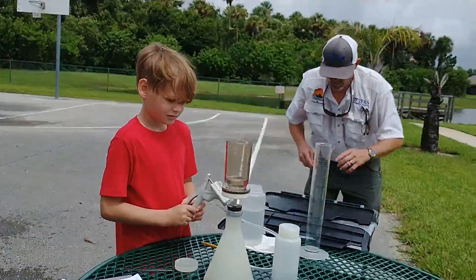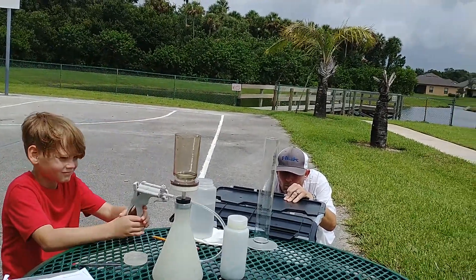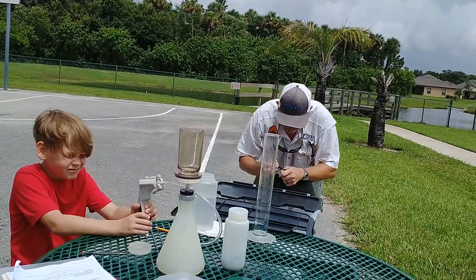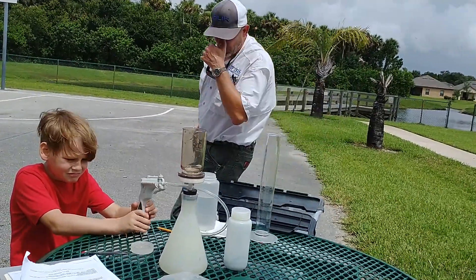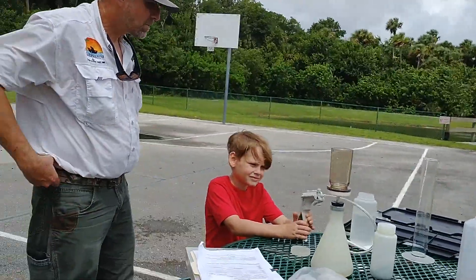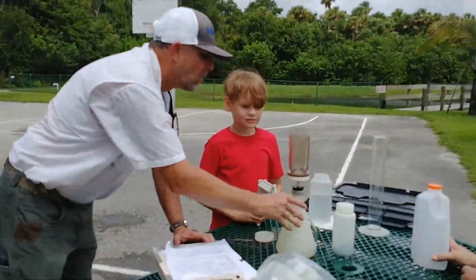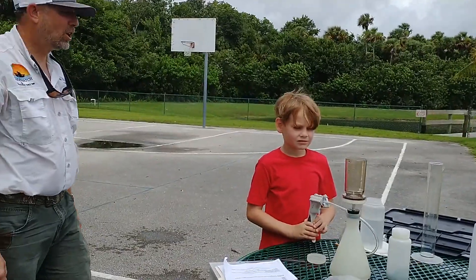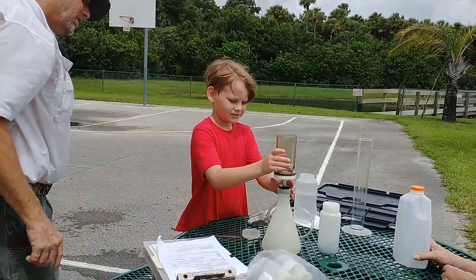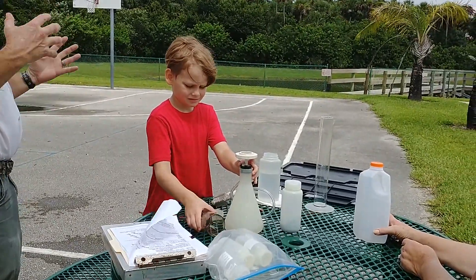At some point when we're filling time, I'd like you to tell us the benefit of doing all this — we're testing our water, and what's our hope at the end here to find out about our water. Now pull the top off. It's yellow — that's algae. Algae can be green, blue-green, or even look like orange paint.